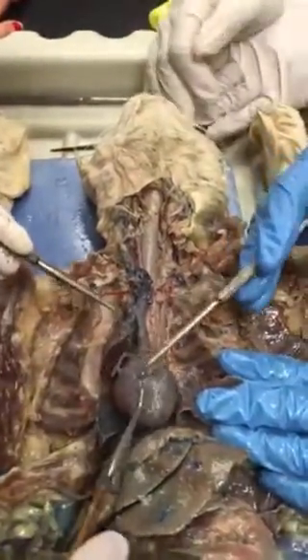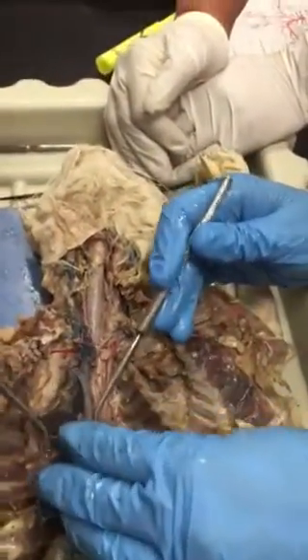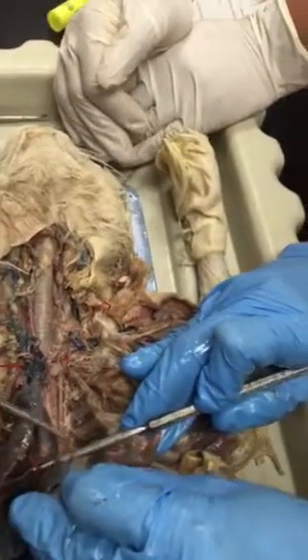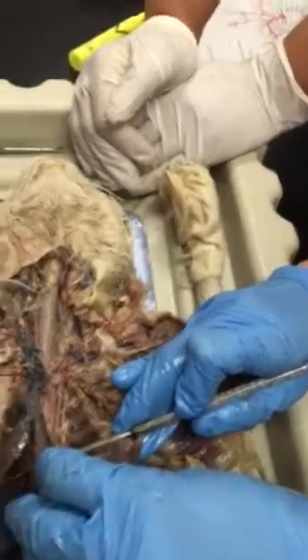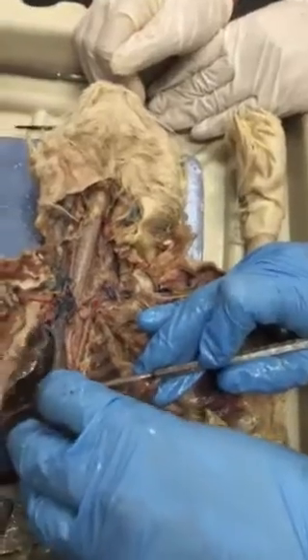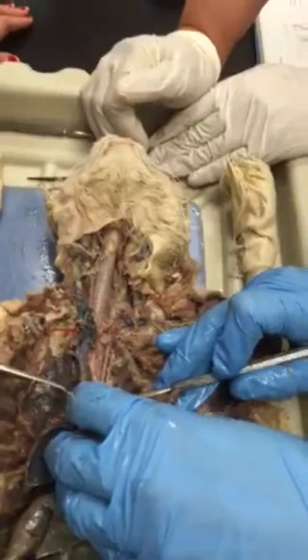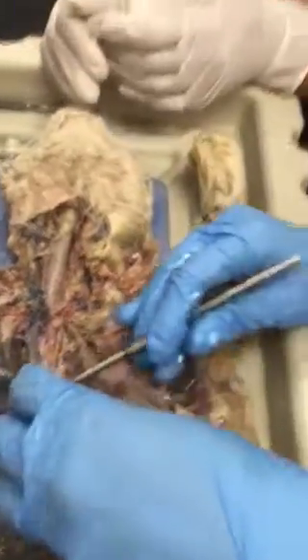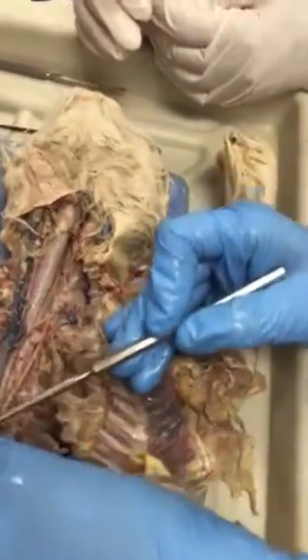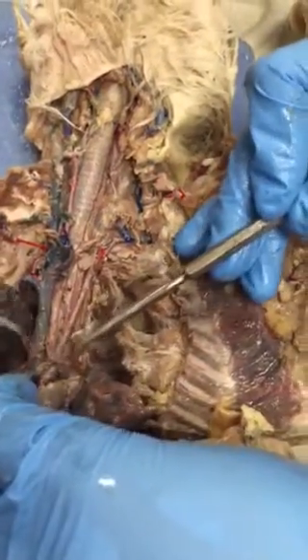All right, so of course this is our heart, and this teeny tiny little part of the aorta would be the ascending aorta, right under here. Under the aortic trunk is probably under here. Well, we just call it the aorta, the ascending aorta. Do they call it an aortic trunk? Is that a term? I've never heard that. We never use trunk for the aorta. Pulmonary trunk we use. So this is technically just the ascending aorta. Aortic arch, that makes an arch.